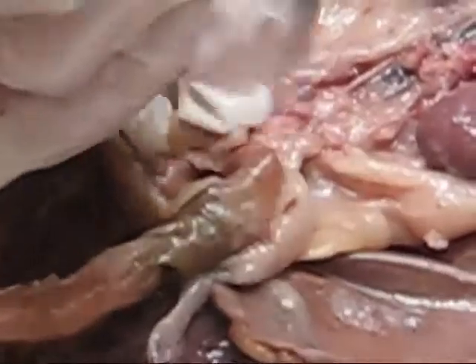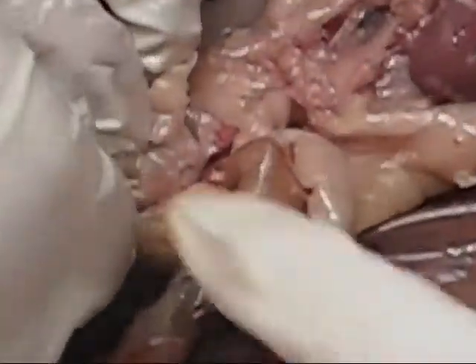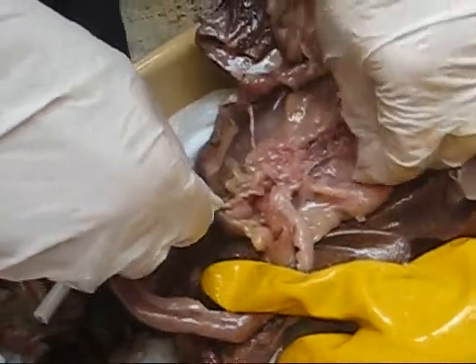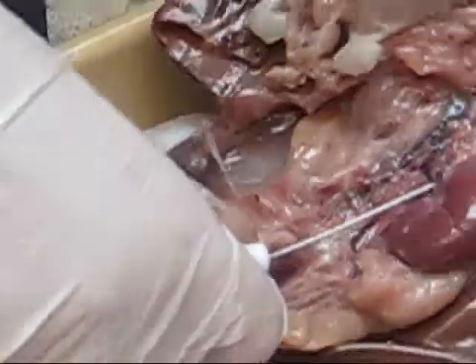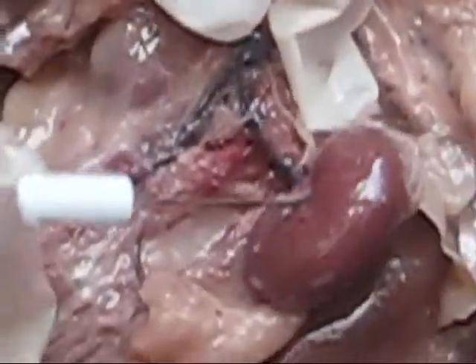Where is the bladder? Right there. This is the urinary bladder. What I'm poking right here is the urinary bladder. You can see the ureter, how it's going all the way down to the urinary bladder. Let's not explode the urinary bladder. The point where everything enters and exits the kidney — just like in the lungs — this is referred to as the hilus.